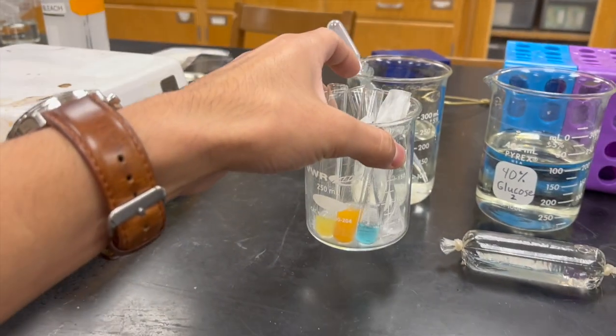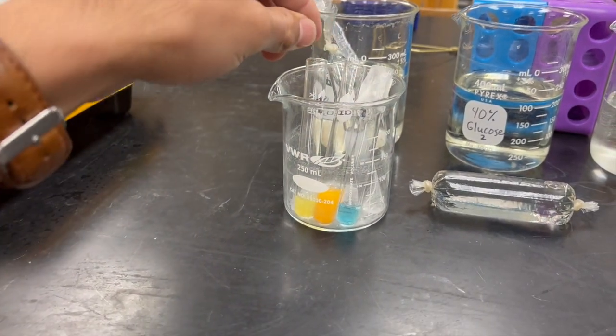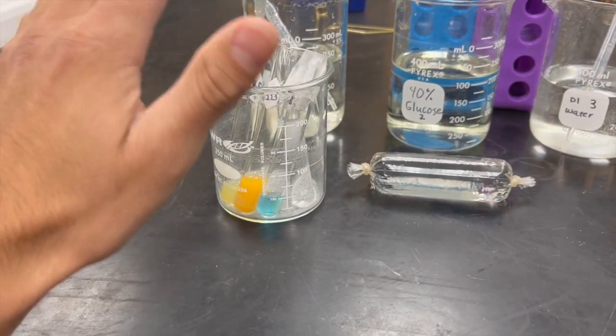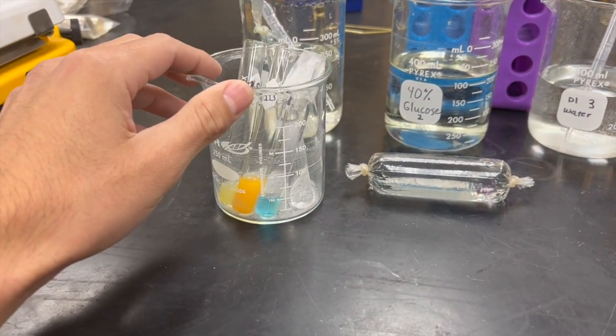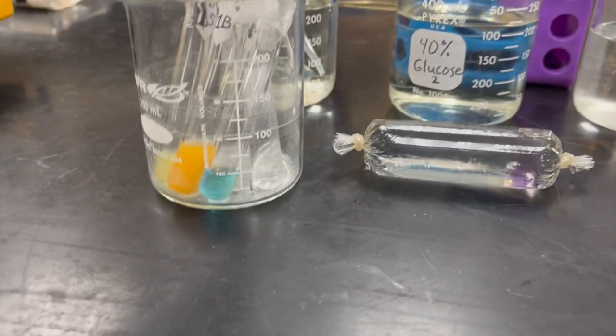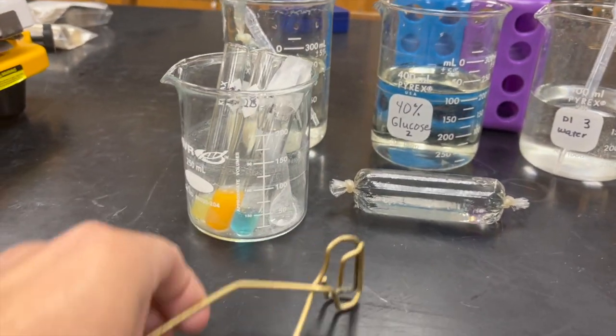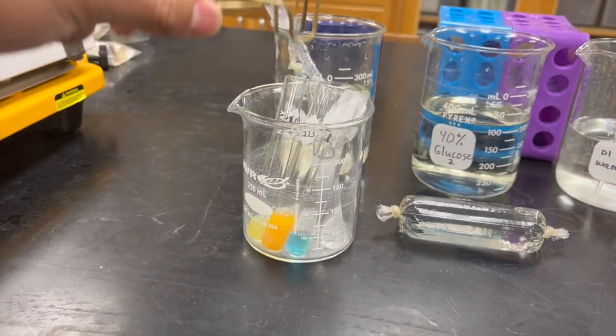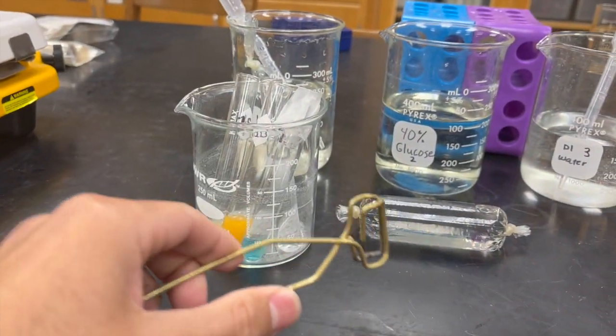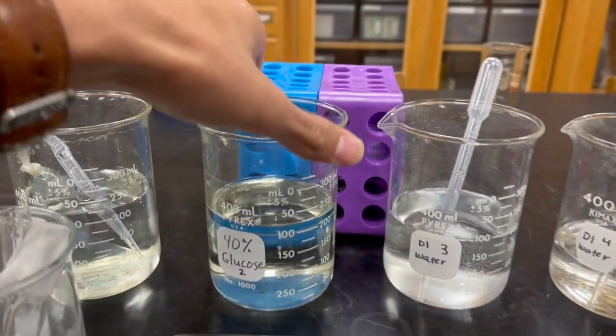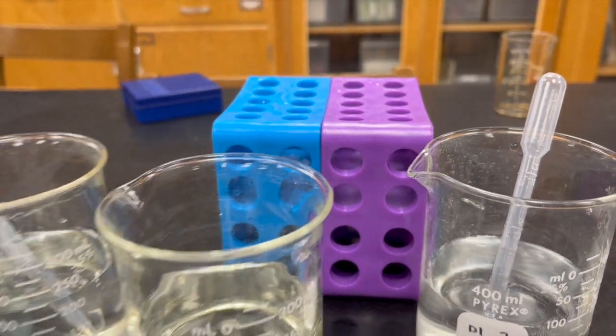They'll transfer it, obviously this is going to be on the hot plate. The water is going to be boiling, so they're going to transfer it into there and leave it in there roughly five minutes or so. Then they're going to use the test tube clamps to go ahead and pull it out and put it into the test tube rack.